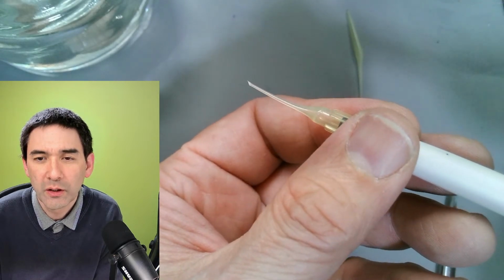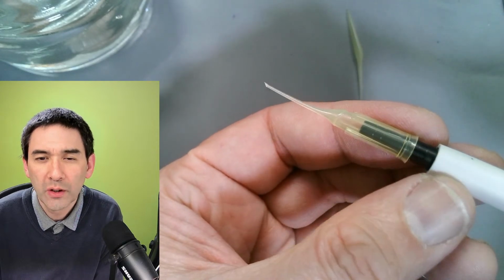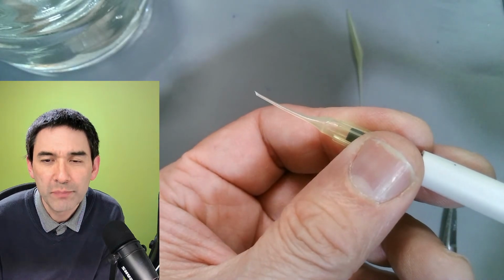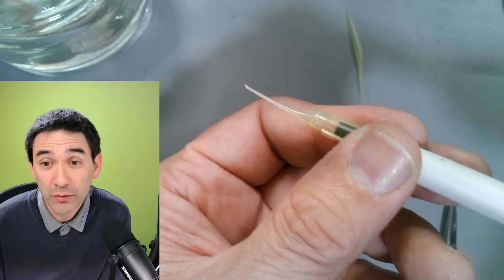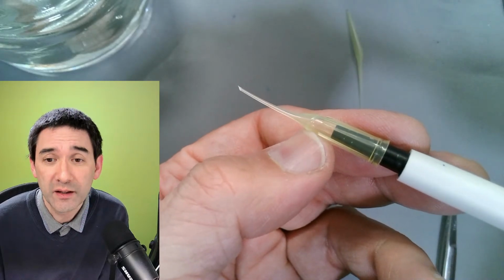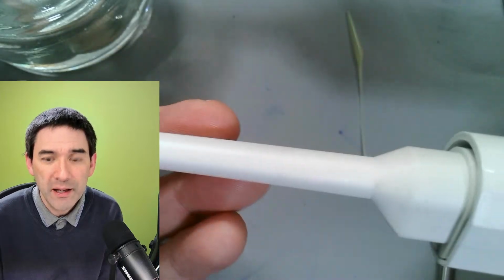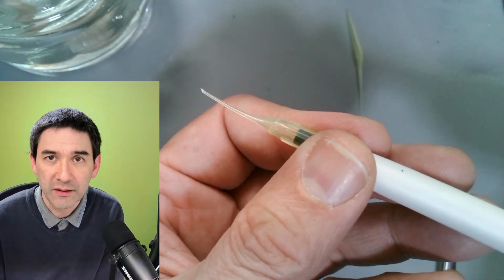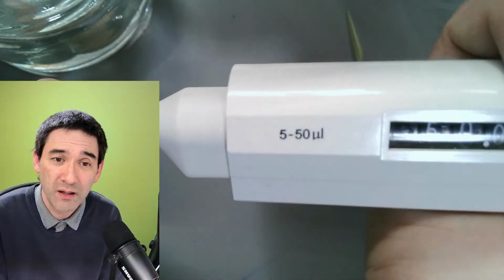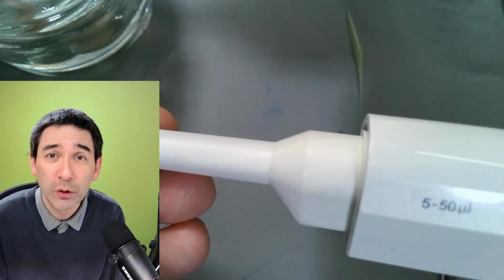So there are now a couple of comments here. What about connecting a rocket air blower used to clean dust from photography equipment? I guess you can control the suction better with it. I never worked with that, don't know much about it. In any case, the volume or the suction is quite small. I tried to use this pipette to actually suck out some of the liquid, and sometimes it worked, sometimes it didn't, because the amount is not very much. So I was not able to get a lot of suction together with that.